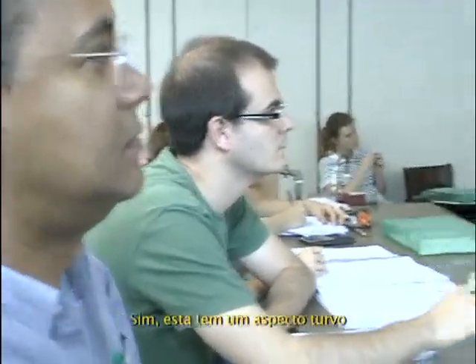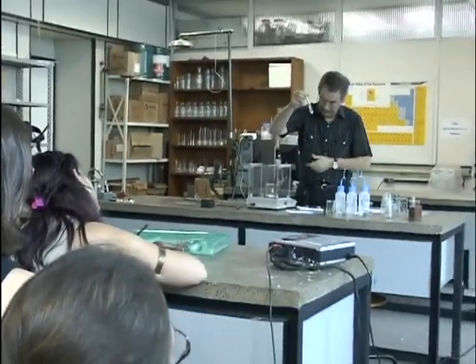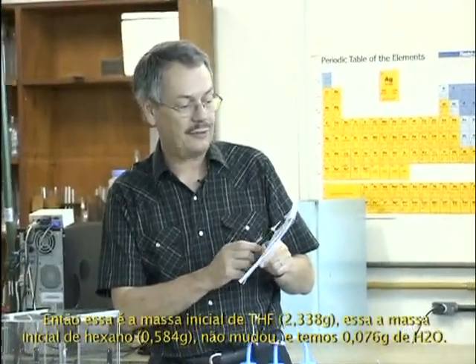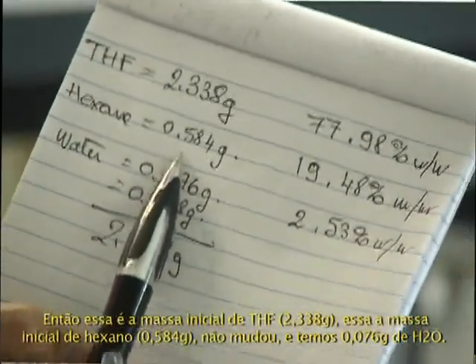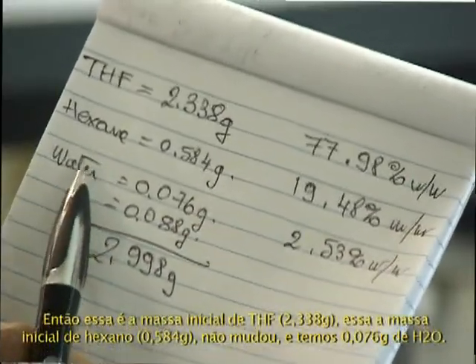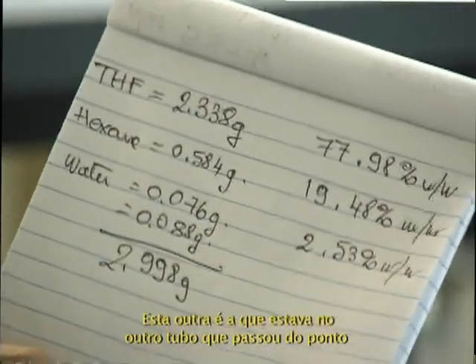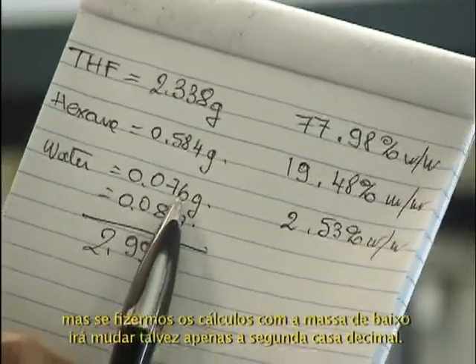So yeah, this one has a kind of cloudy aspect. It's no more 100% clear, so let's make the calculation. So this is the initial mass of THF. This is the initial mass of hexane, didn't change. And we add 0.076 gram of water. It could be the second one, which is actually in this tube, but I think it's a little bit past. You see the change that's made.